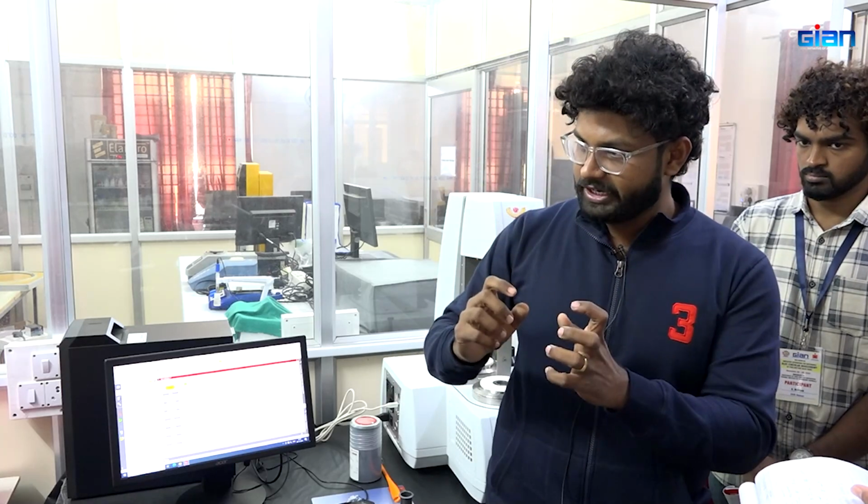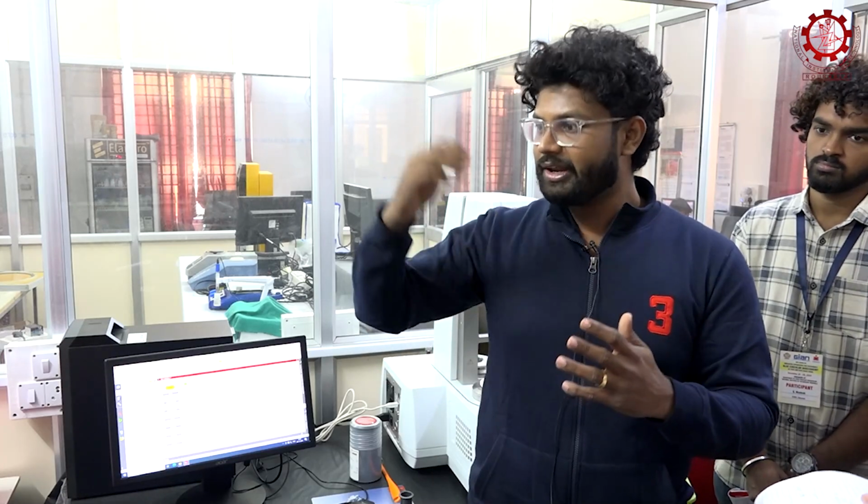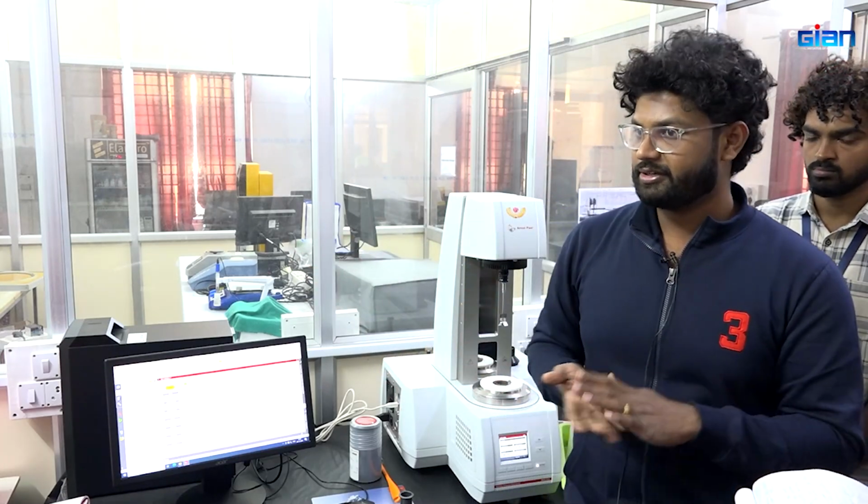Now what is peak temperature, peak viscosity? I will explain those now. First, peak viscosity. What is the peak viscosity? Obviously from 50 we are heating to 95, right? The maximum viscosity that is reached when we are heating is known as peak viscosity.